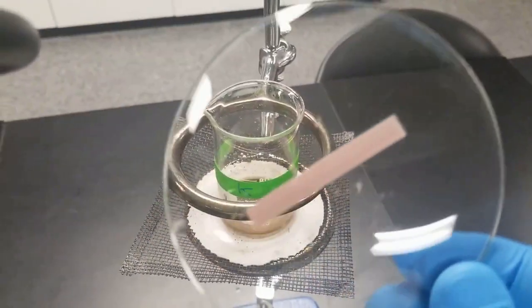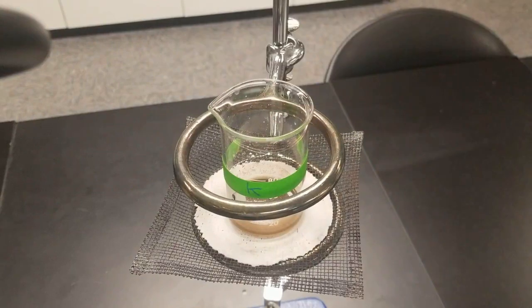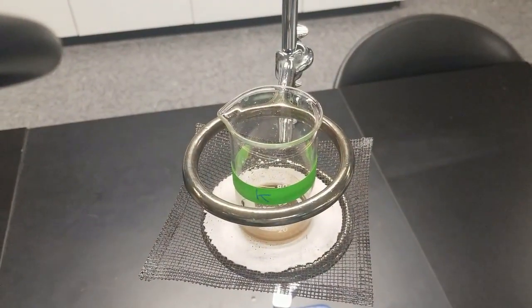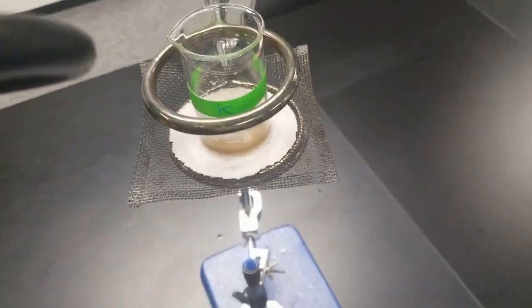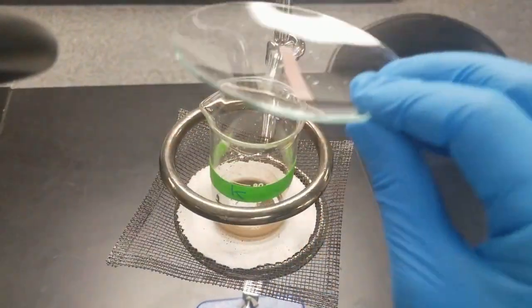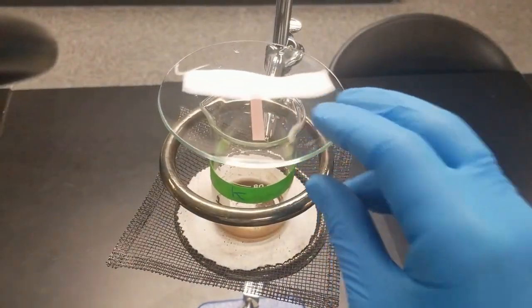All right, so I'm going to put this piece of litmus paper over top of here, and you want to keep an eye on the color of the litmus paper. So I'll turn on the heat. You can tell I've increased the height between our flame so we can gently heat. So again, keep an eye on this color. You see it hasn't changed yet. Let's see what happens when we put it over the solution.